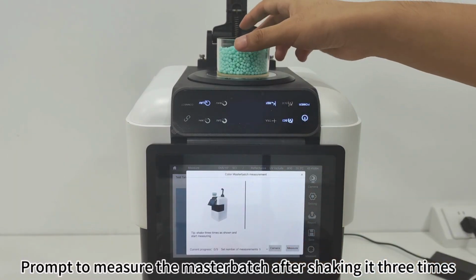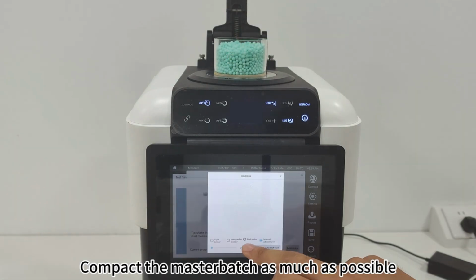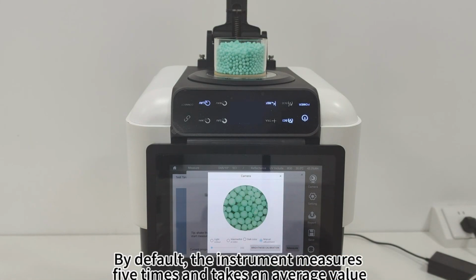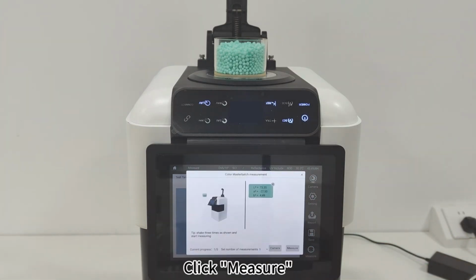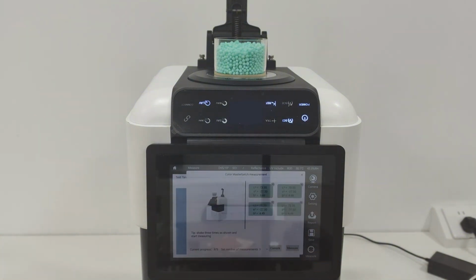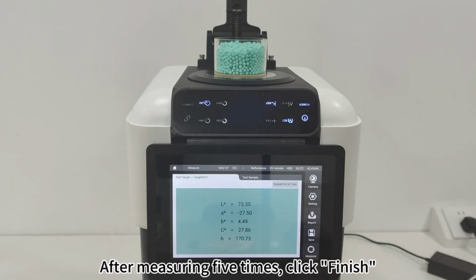Prompt to measure the master batch after shaking it 3 times. Compact the master batch as much as possible. By default, the instrument measures 5 times and takes an average value. Click Measure. Second measurement, third measurement, fourth measurement. Fifth measurement. After measuring 5 times, click Finish.